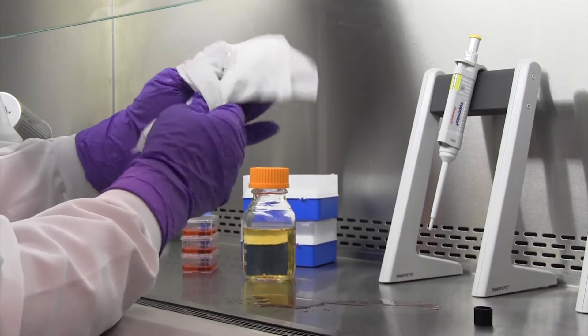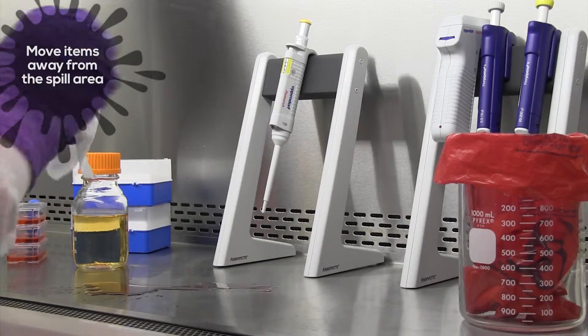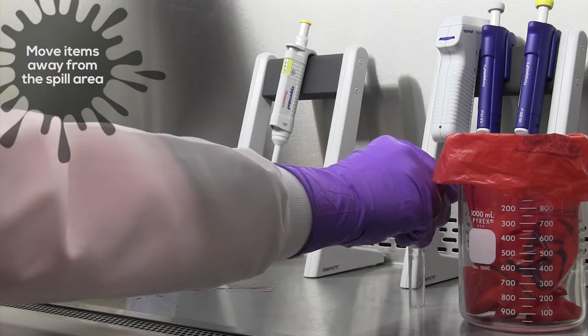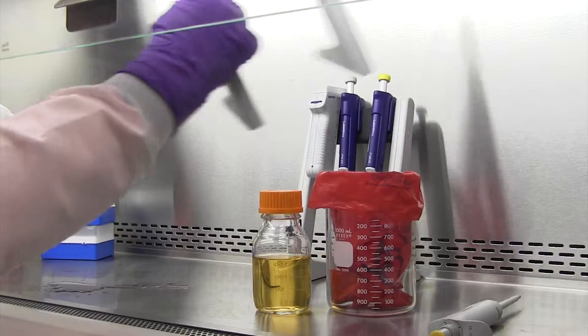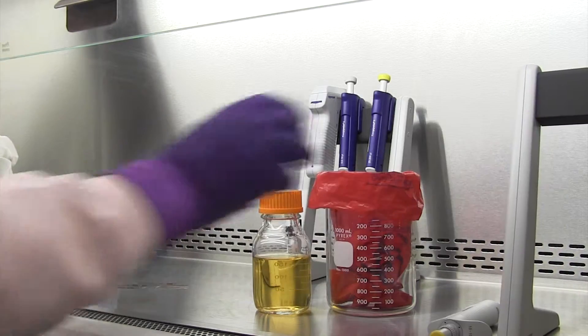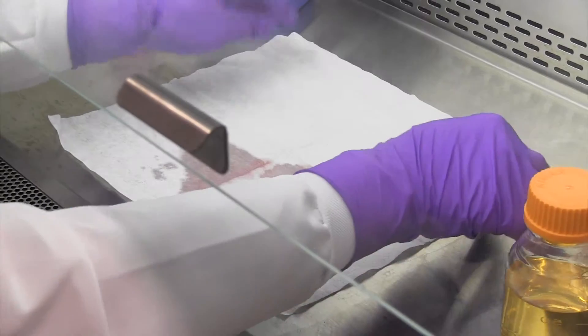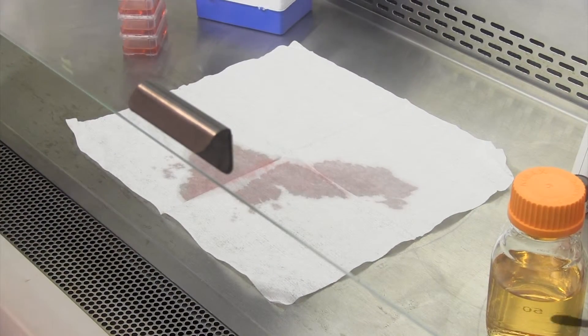First, move items away from the spill area. Next, cover the spill with absorbent material such as towels.